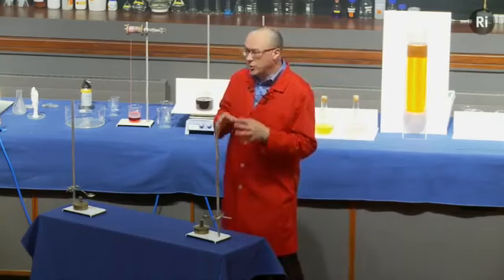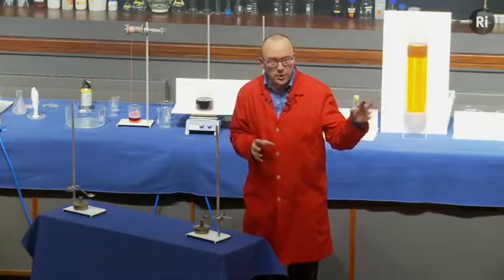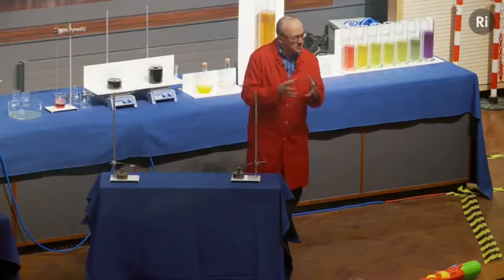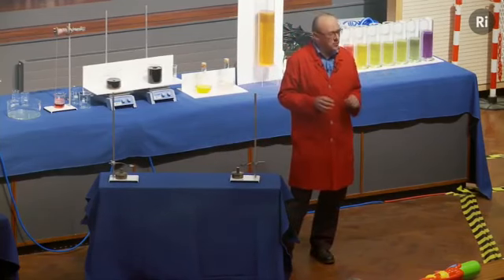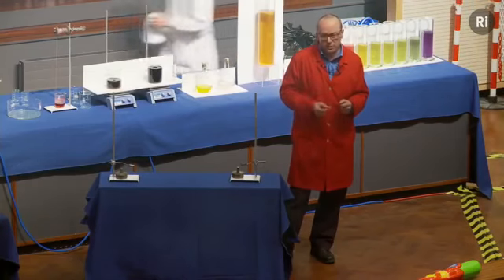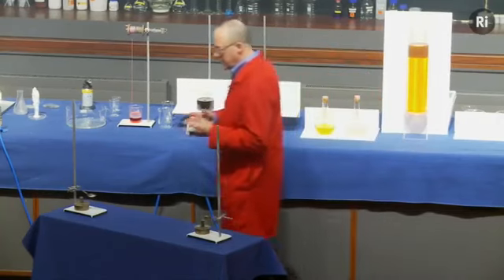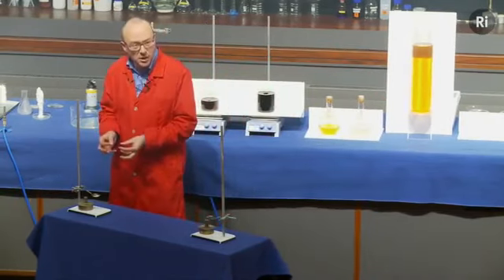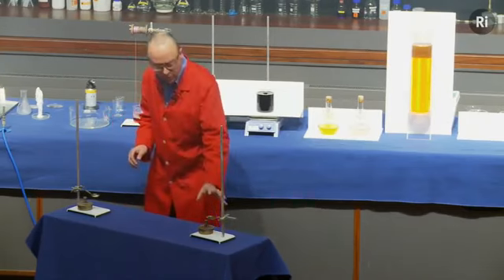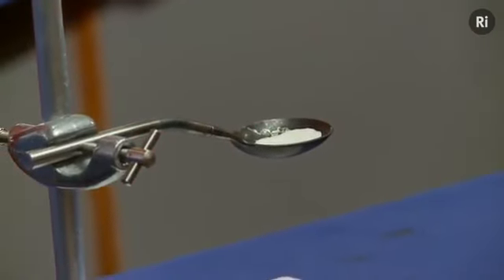What would happen if we took gunpowder and instead of using charcoal, which is the main fuel, we use some of the powder from a fire extinguisher? So this seems pretty odd. We're going to take away the main fuel from the gunpowder and we're going to replace it with something that's used in a fire extinguisher. In fact, we're going to use potassium carbonate for this. So if we mix those 3 things together, that is potassium nitrate, potassium carbonate and sulfur, we get something called yellow powder. And so in this spoon we have a gram of black powder, and in this spoon we have a gram of yellow powder.